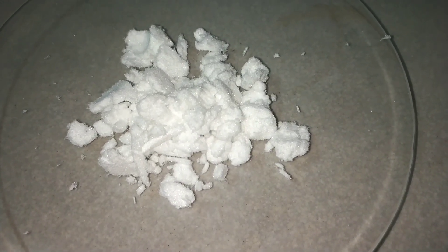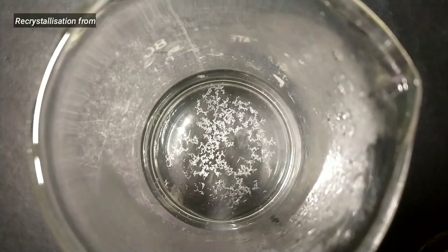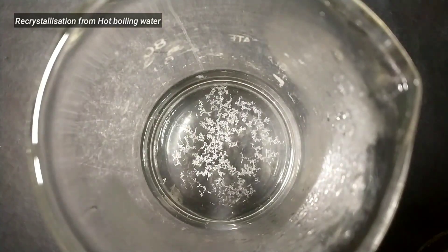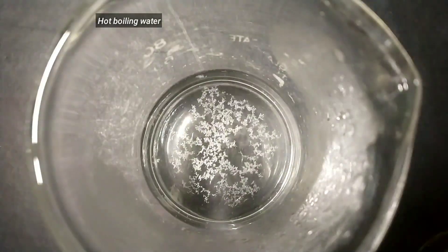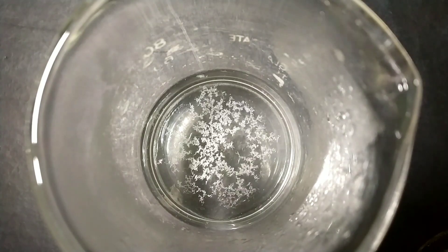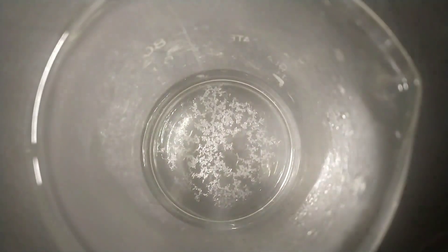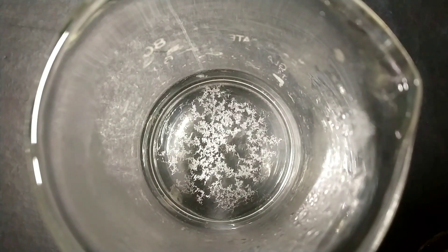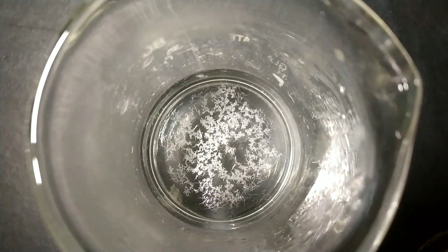It can be easily purified by recrystallizing it from hot water. Hippuric Acid is sparingly soluble in cold water but extremely soluble in hot water. So after dissolving it in hot water and slowly cooling, you can see that beautiful needle-shaped crystals of Hippuric Acid start to separate from the solution.